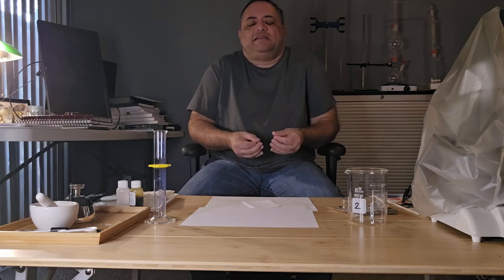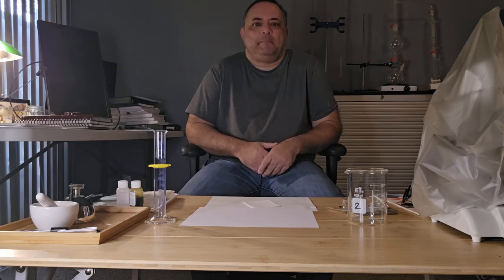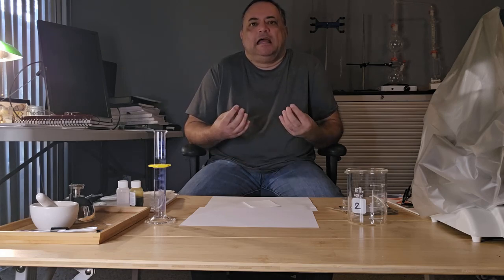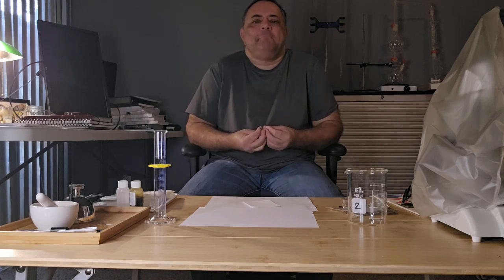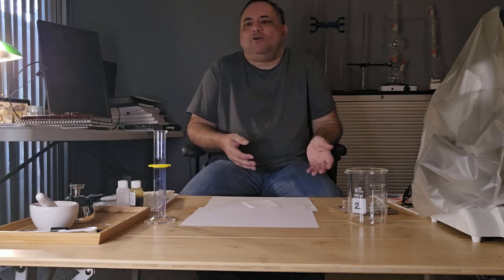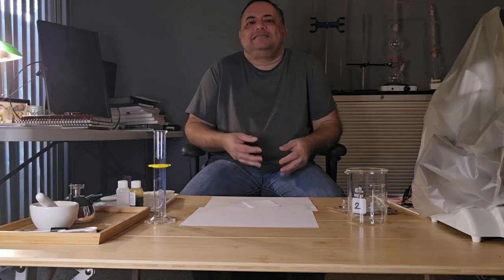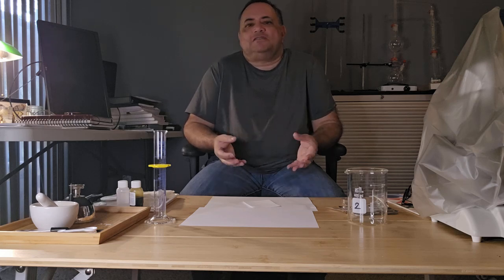For today's video, the purpose of the experiment is to demonstrate chromatography, and we're going to demonstrate that by separating plant pigments. Now, plants make an amazing variety of pigment molecules. As you know, they're not all green. They come in different colors: yellows, blues, purples, reds, oranges. So what's causing the colors in these plants, flowers, fruits, are different plant pigments.